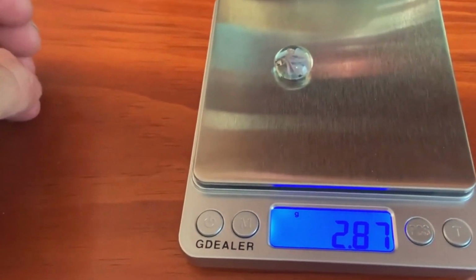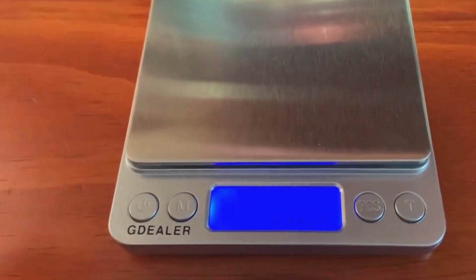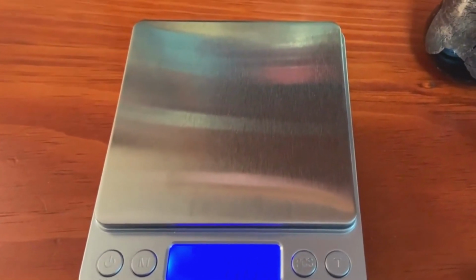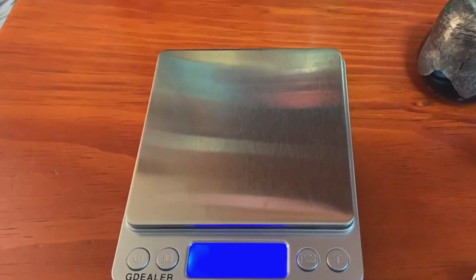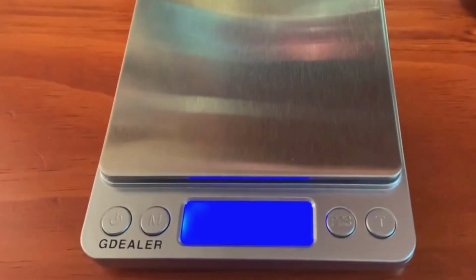All right, once you've done that, you're going to repeat the sequence, large, small, medium, or whatever you established, until you've recorded your data 5 times for each of the objects. And then you'll need to follow the directions to calculate the data in the format that you need. Okay, I hope you enjoy using your little balance.